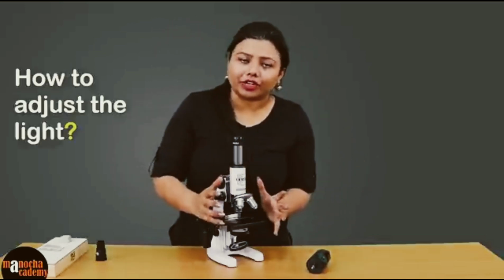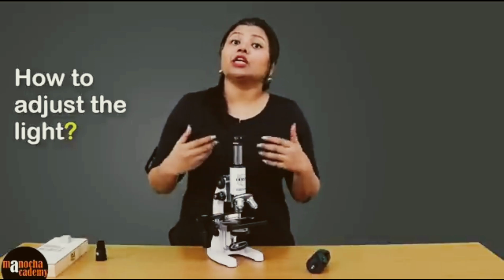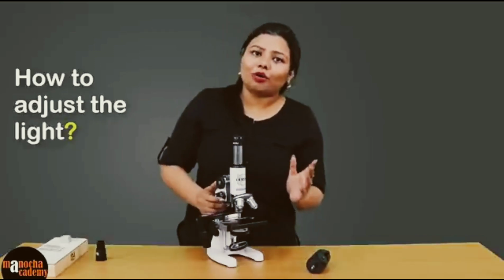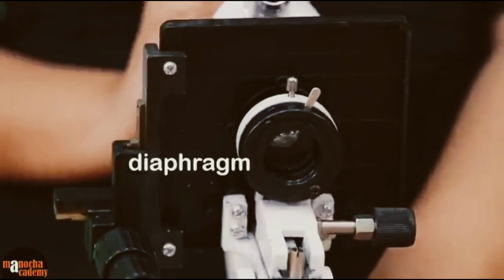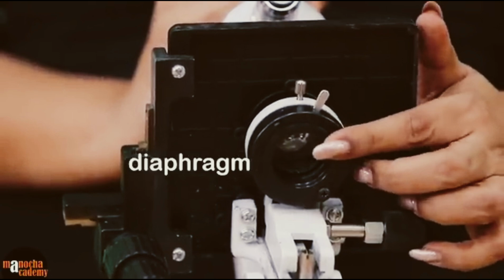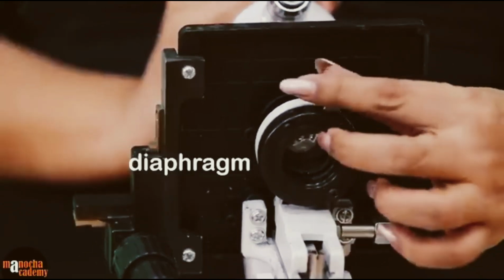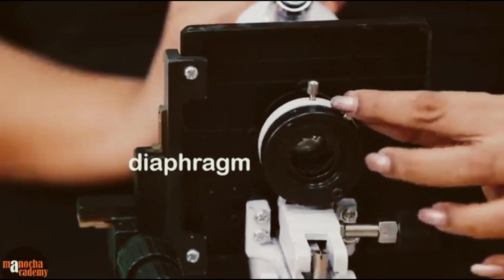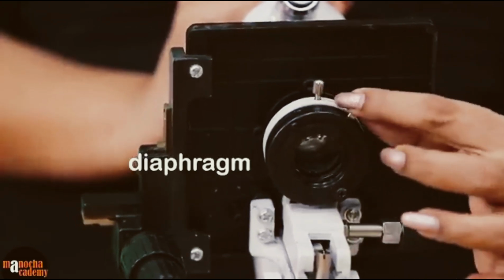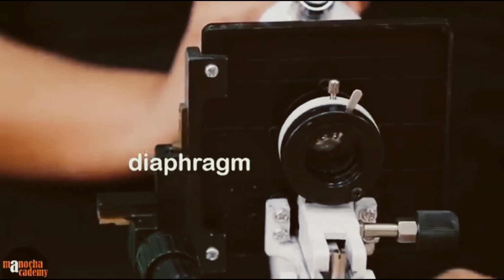If you want to adjust the amount of light entering, let's say the microscopic field is appearing too bright, you might want to reduce the amount of light. In that case, we have a diaphragm here, which you can rotate to adjust the amount of light entering and leaving. This diaphragm is almost like the iris of your eye. So with the iris, just like you decrease or increase the diameter of your pupil, you can do that same thing with this diaphragm.